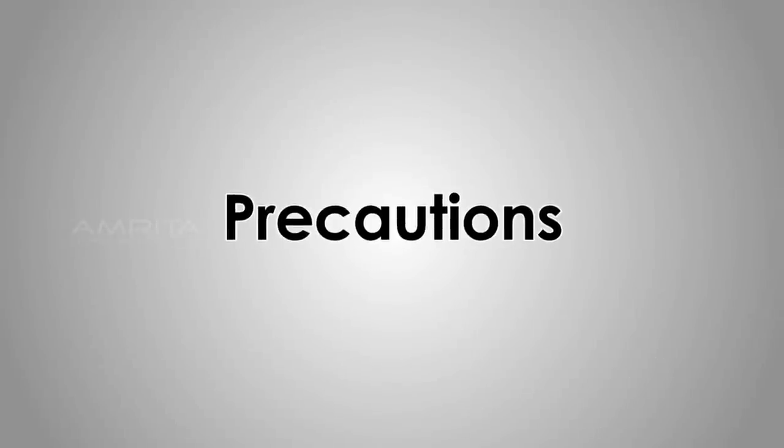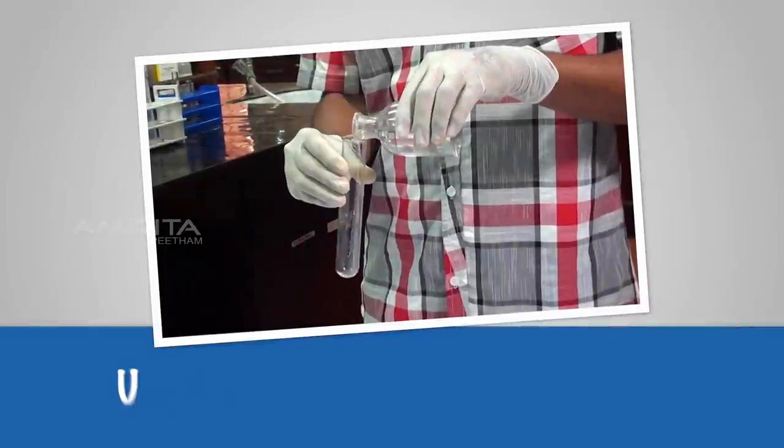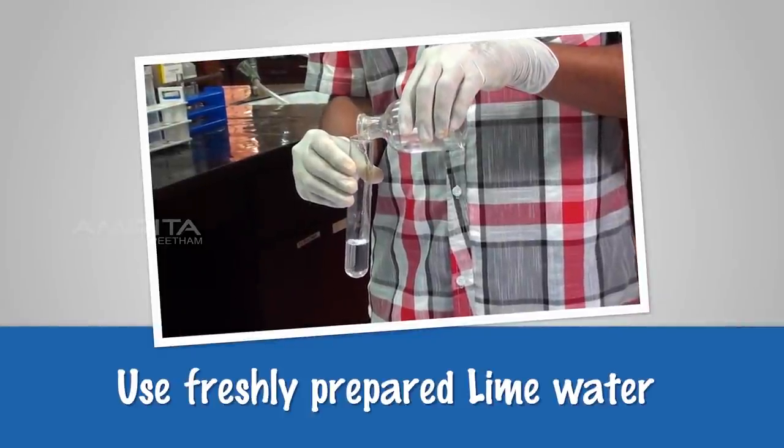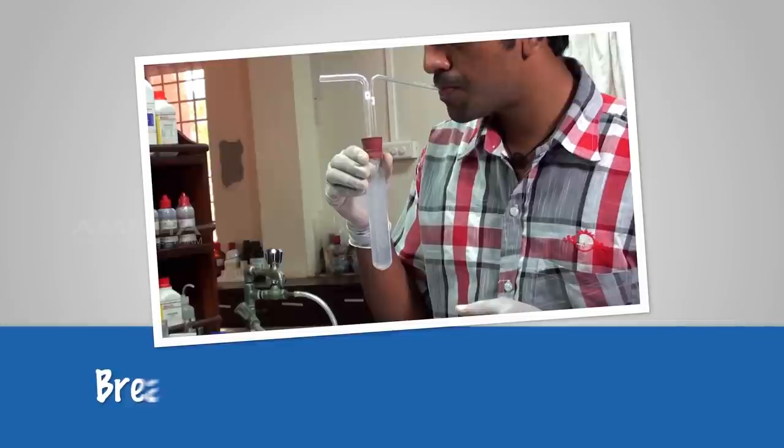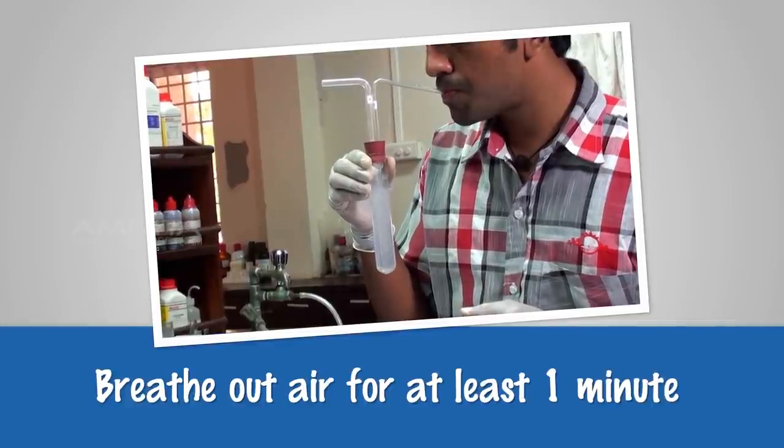Precautions: Use freshly prepared lime water. Breathe out air for at least one minute.